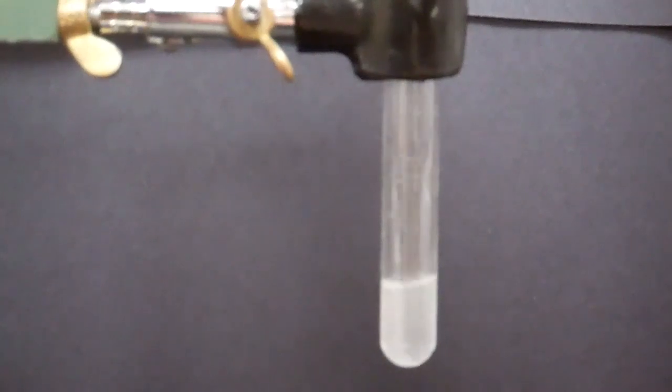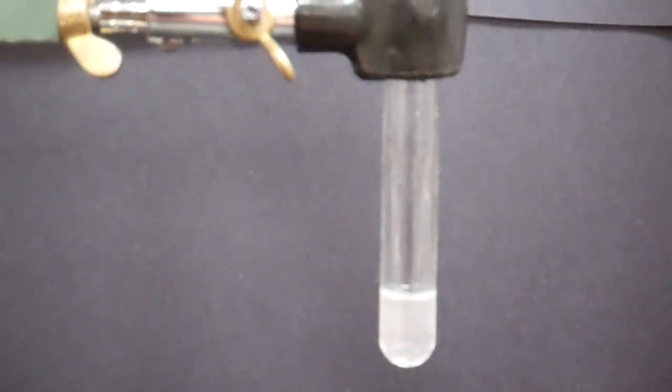Since I want a saturated solution, I'm not going to add any more distilled water to clear up this cloudiness. Plus, this test does not involve formation of a white precipitate, so this cloudiness is not going to affect our results.